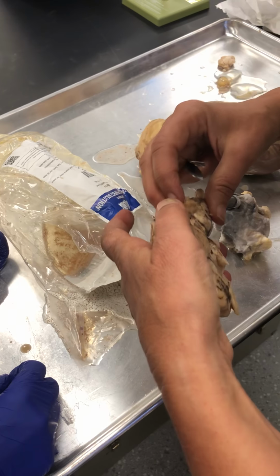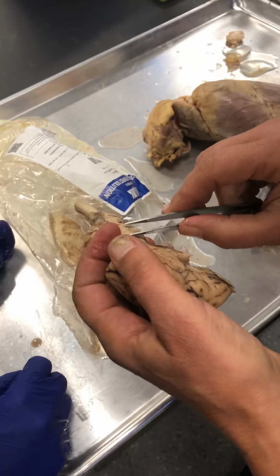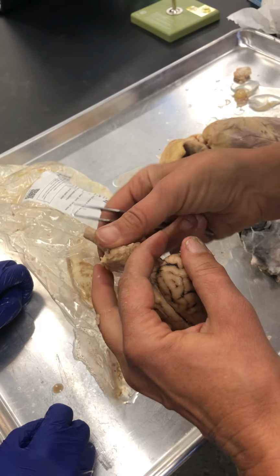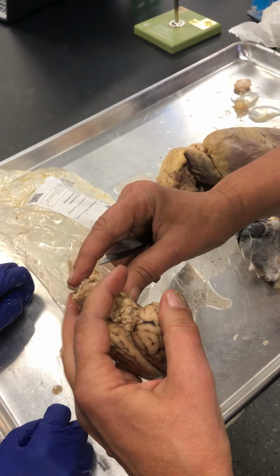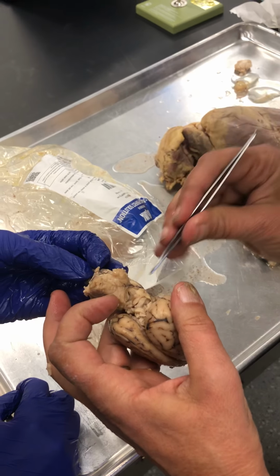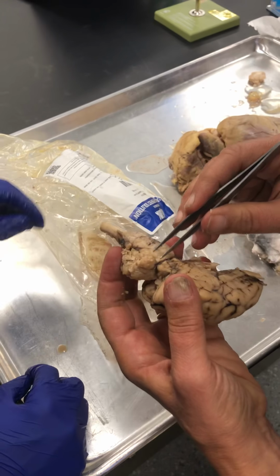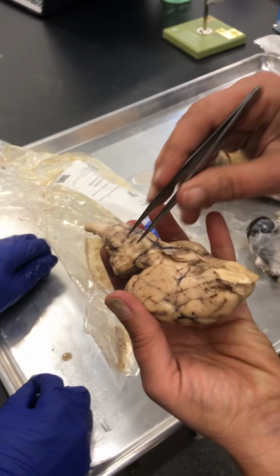You can see, if you stretch a little bit this way, gently, of course, you can see pretty clearly, let me see. Here we go. I need one more finger. Could you just hold the tail down, just not ripping it off, just gently. See this rod right here, this stalk? That's the superior cerebellar peduncle. Then on the side here, this is the middle cerebellar peduncle that forms the transverse fibers of the pons.